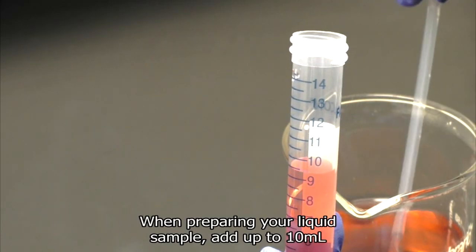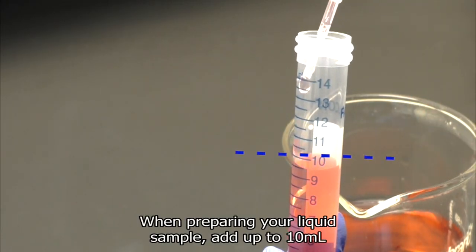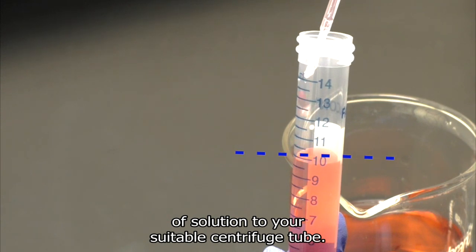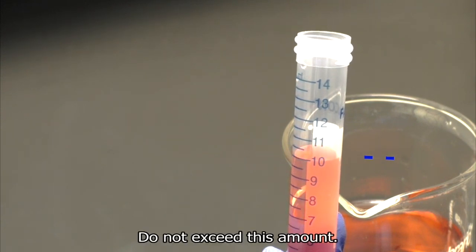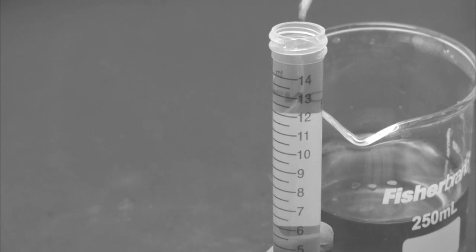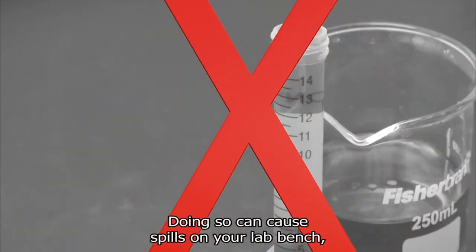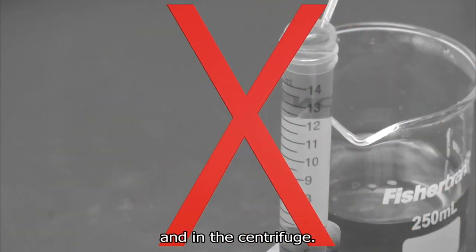When preparing your liquid sample, add up to 10 milliliters of solution to your suitable centrifuge tube. Do not exceed this amount. Doing so can cause spills on your lab bench and in the centrifuge.